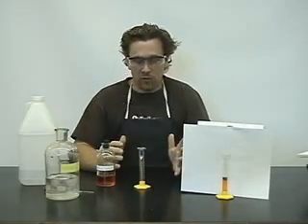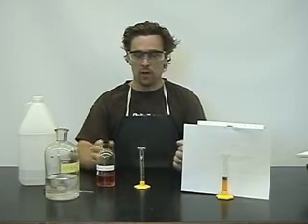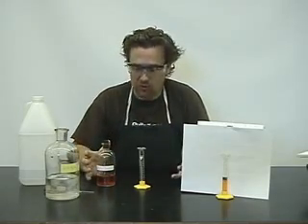Today we're going to do a little demo and we're going to call it the breathalyzer demo. It is a really cool reaction.